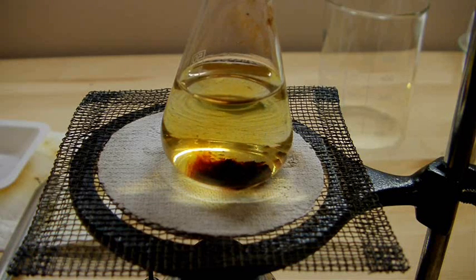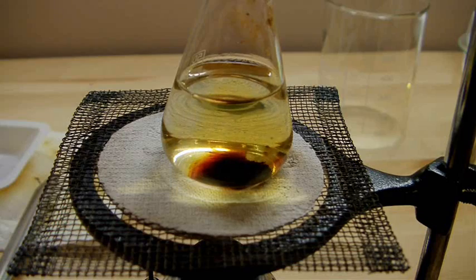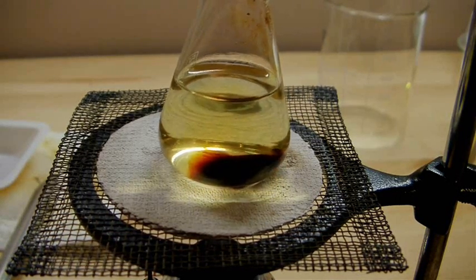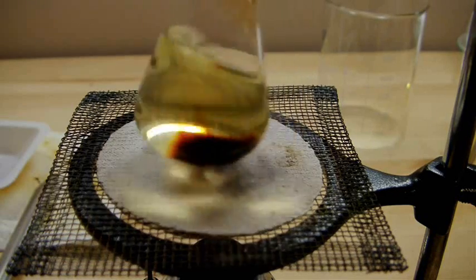But first let's add the rest of the iodine. You can also tell you're nearing the end when you mix it and the color persists for quite a while longer.